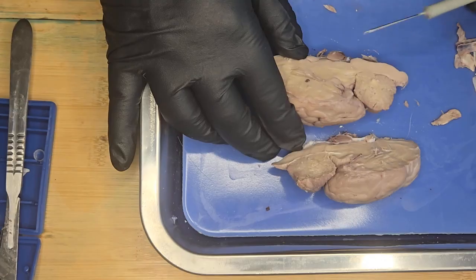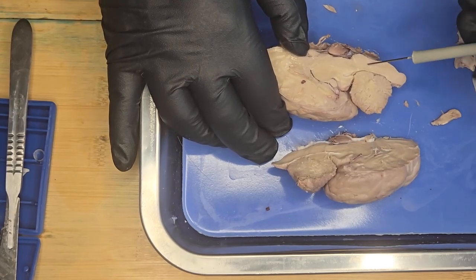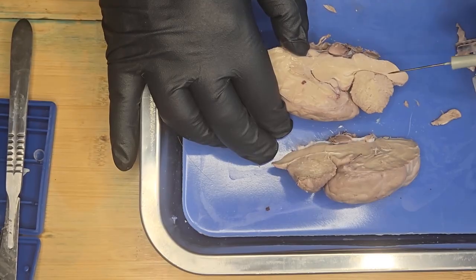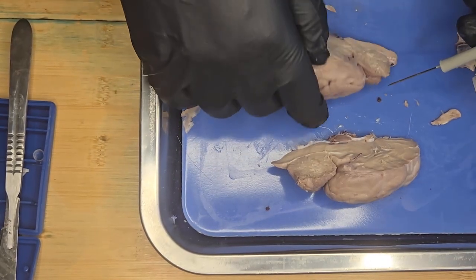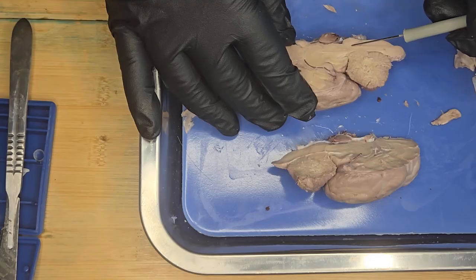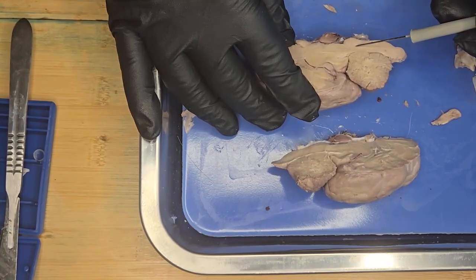Below that, here is the medulla region. And the medulla is the lowest part of the brain stem, and it connects the brain to the spinal cord, which is here. Spinal cord is here. It controls heart rate, breathing, blood pressure. Any damage to this region, the medulla, can be life-threatening.